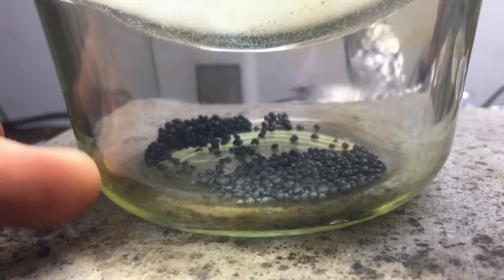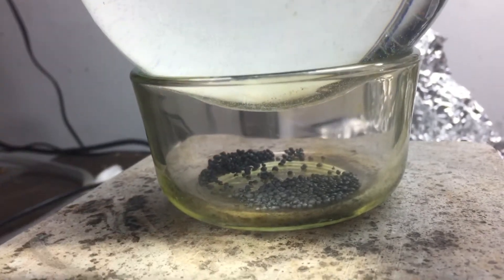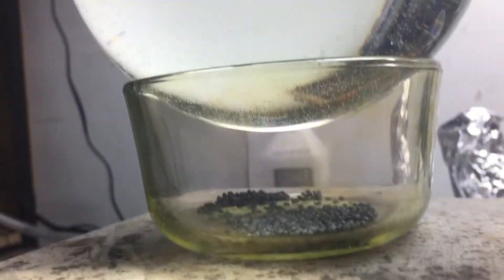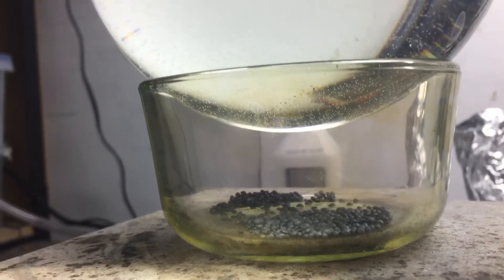Basically this is fairly simple to understand — the iodine is just going to be heated and redeposited on the bottom of here. So I'm going to set up a time lapse and show the recrystallization process.